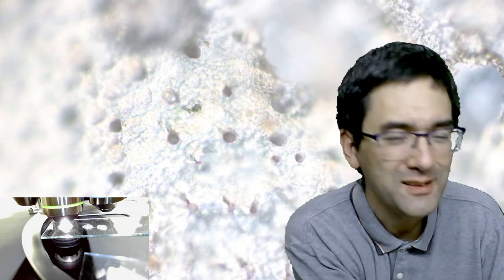Let's switch to the microscope view, remove and switch to the lowest magnification first before changing. Go up - it's way out of focus. Let's see if we're lucky. Look - this little hair you can even see here. It's totally blurry because it's not flat. Those dark things you see have a little extension - I think these could be impressions of the tiny little hairs the leaf has on the bottom.